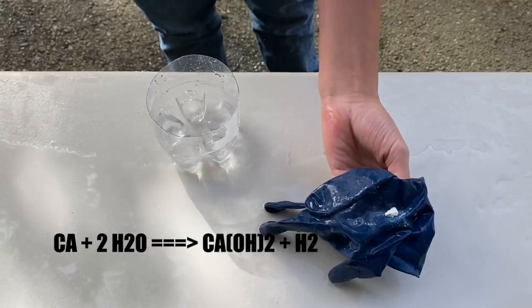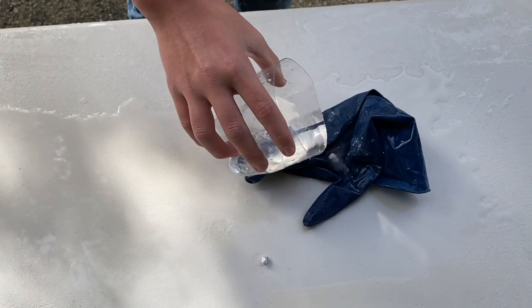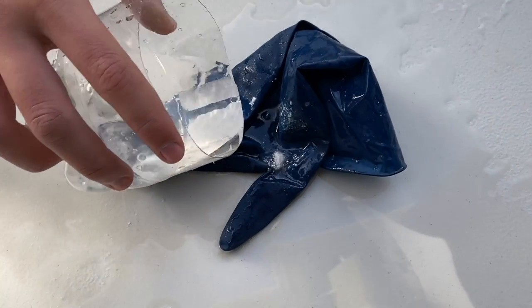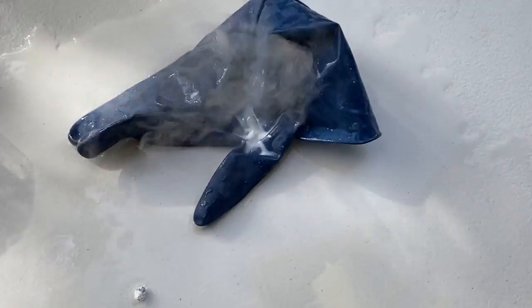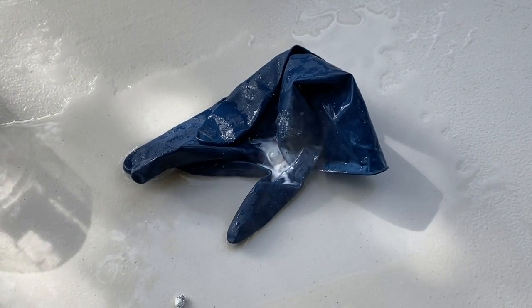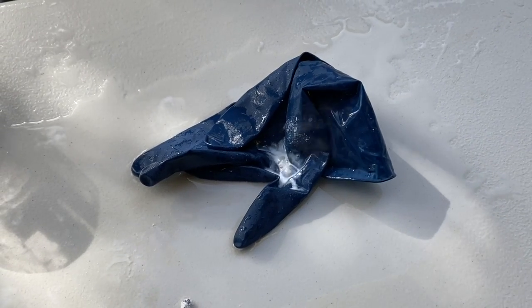For a single displacement reaction, we decided to use the reaction between calcium and water, in which calcium replaces a hydrogen atom, creating calcium hydroxide and hydrogen gas. When we observe this reaction, we can see white paste forming on the surface of a calcium pebble. This white paste is calcium hydroxide, while the bubbles forming on the side too is hydrogen gas.